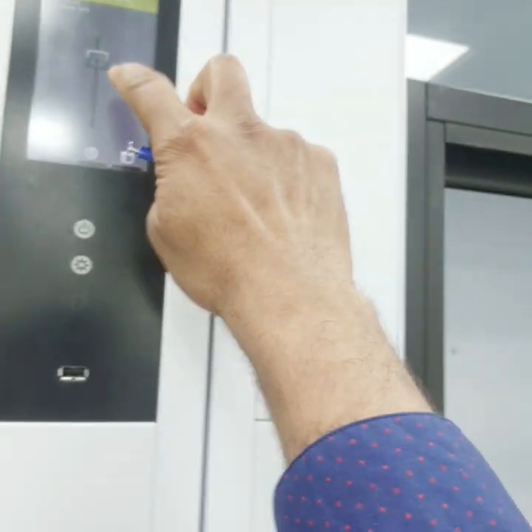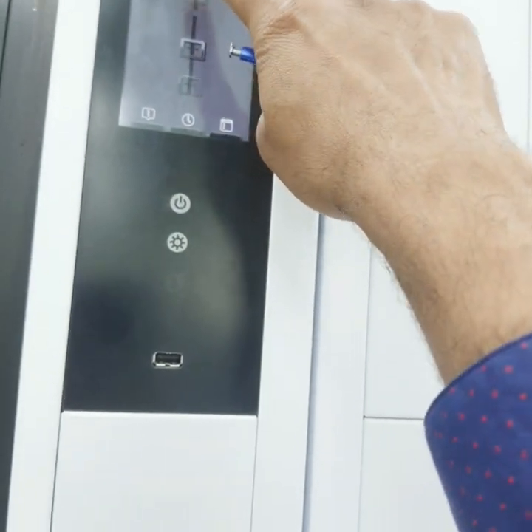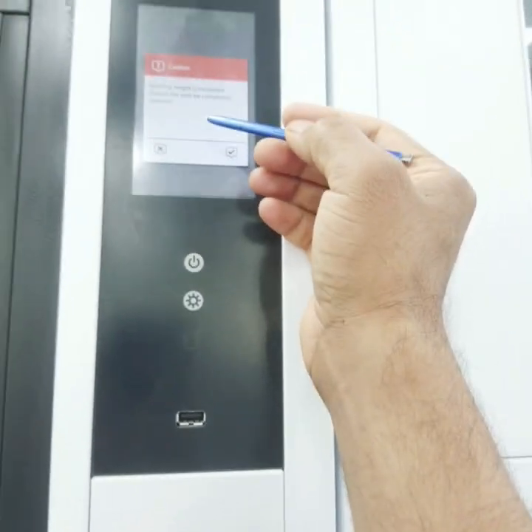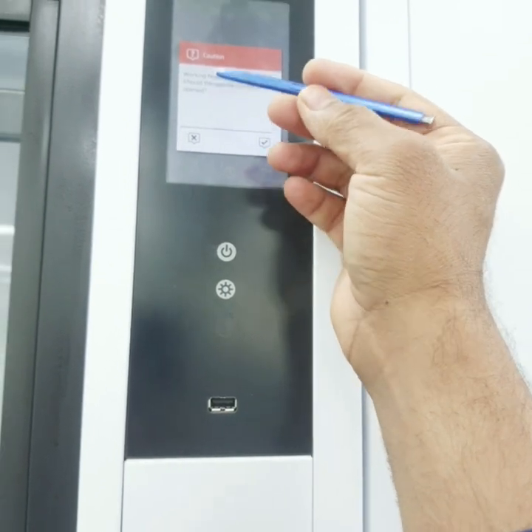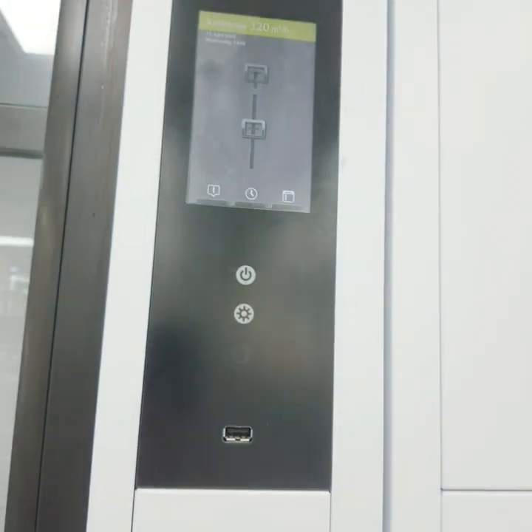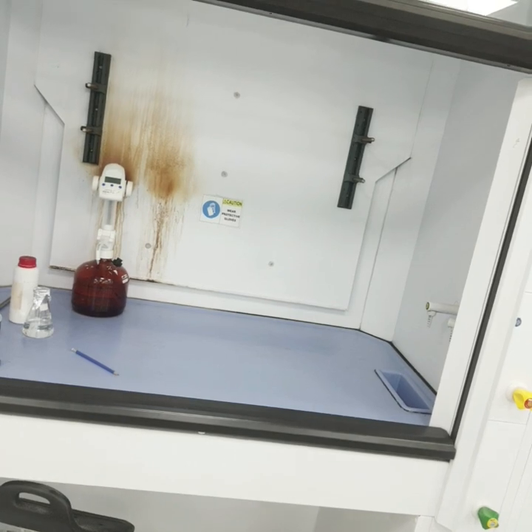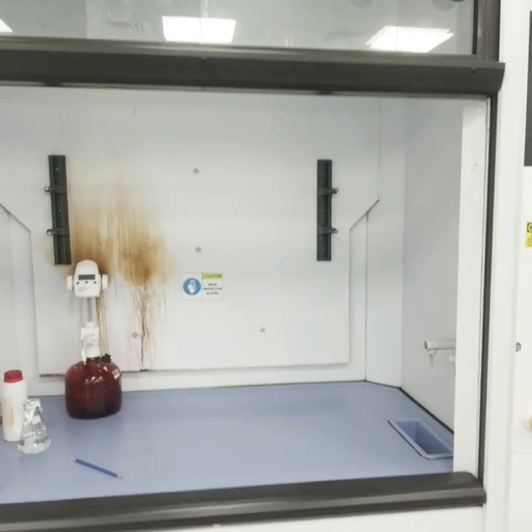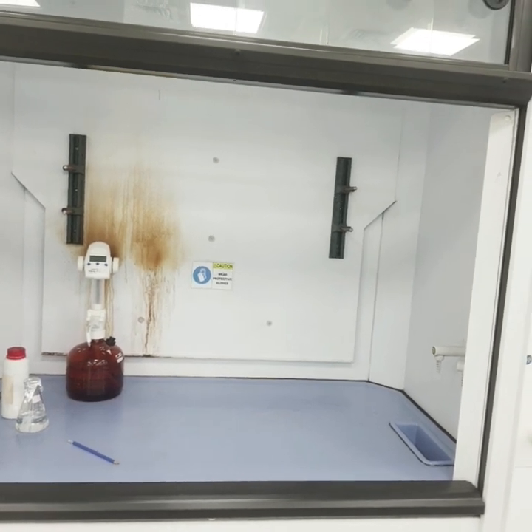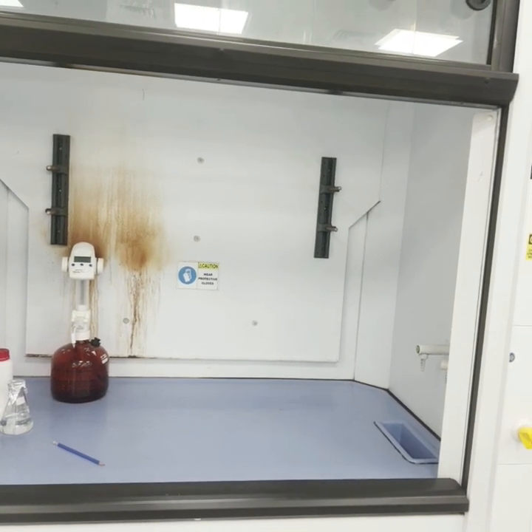The door can be adjusted manually up or down. When it is raised too high, it says 'working height exceeded' — this refers to the sash height. The fume hood basically confines hazardous airborne material by diluting it with a large amount of air, drawing it to an exhaust system, and expelling the air through vents on the roof of the building.